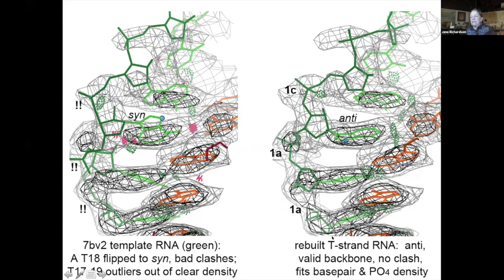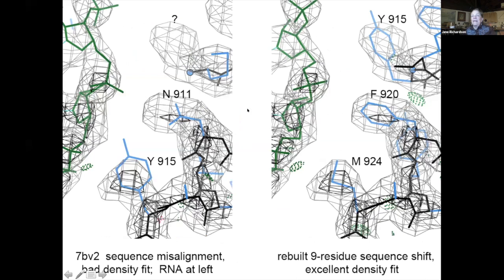And the remdesivir inhibitor is sort of down here. So it probably doesn't affect that inhibitor, but it's pretty close to it. And then that same structure had a sequence misalignment where you can see there's not enough model in this one or this one, and there's a little too much model where this tyrosine is. When the sequence is lined up correctly, each side chain really fits its density. This is at about 2.5 angstroms.